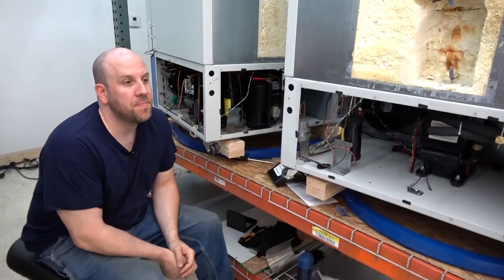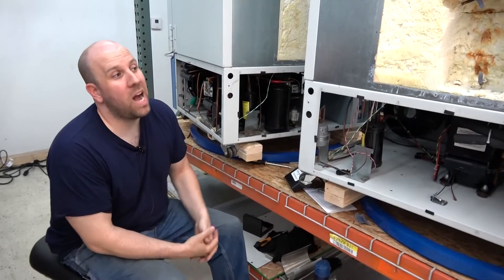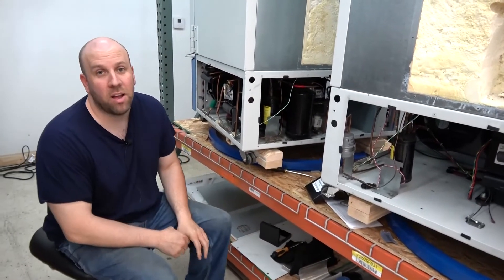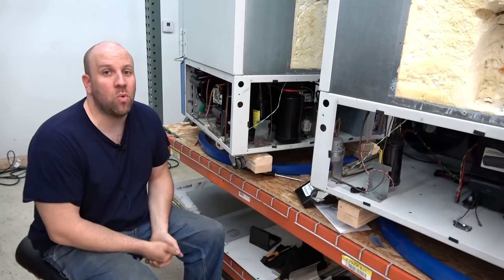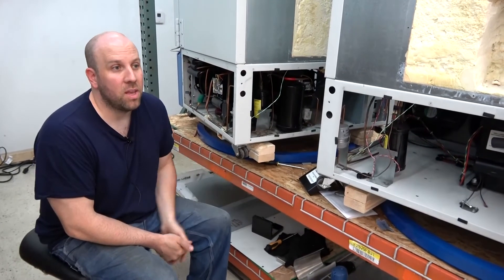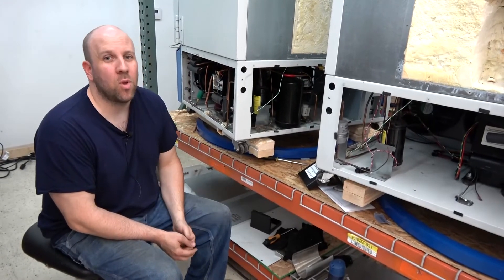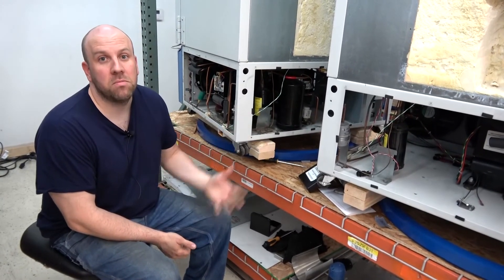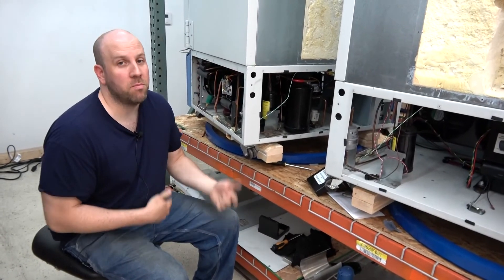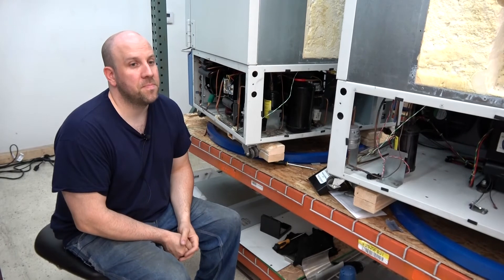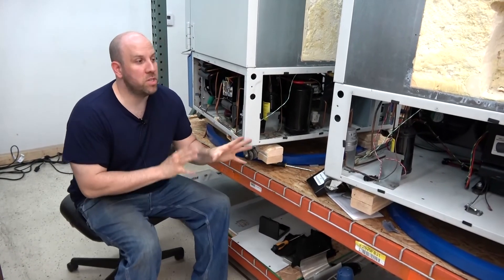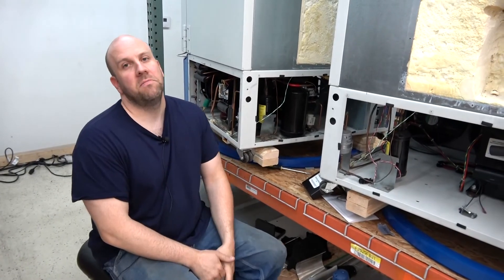We're constantly working through these. We probably have 20 or 30 freezers right now. And we're working through—pretty much each one is going to receive that treatment for the most part, unless they're really old and not worth the time or they perform like new. And if they don't perform like new, then they're going to get the treatment. So we'll have them coming out here constantly. Thanks a lot for watching. Hope you enjoyed the little demonstration. Thanks.